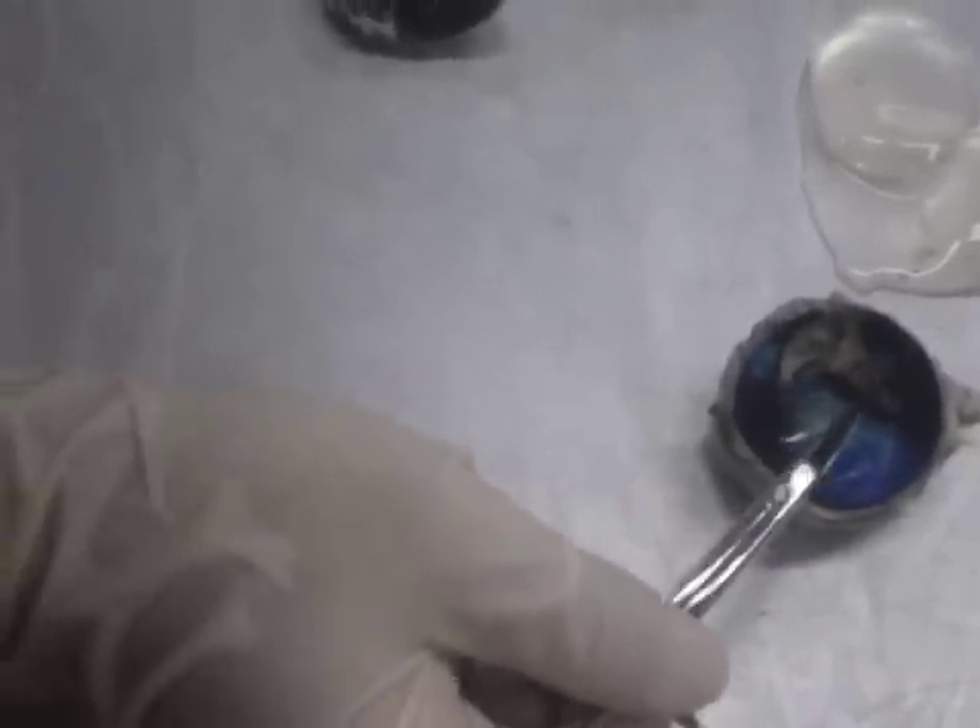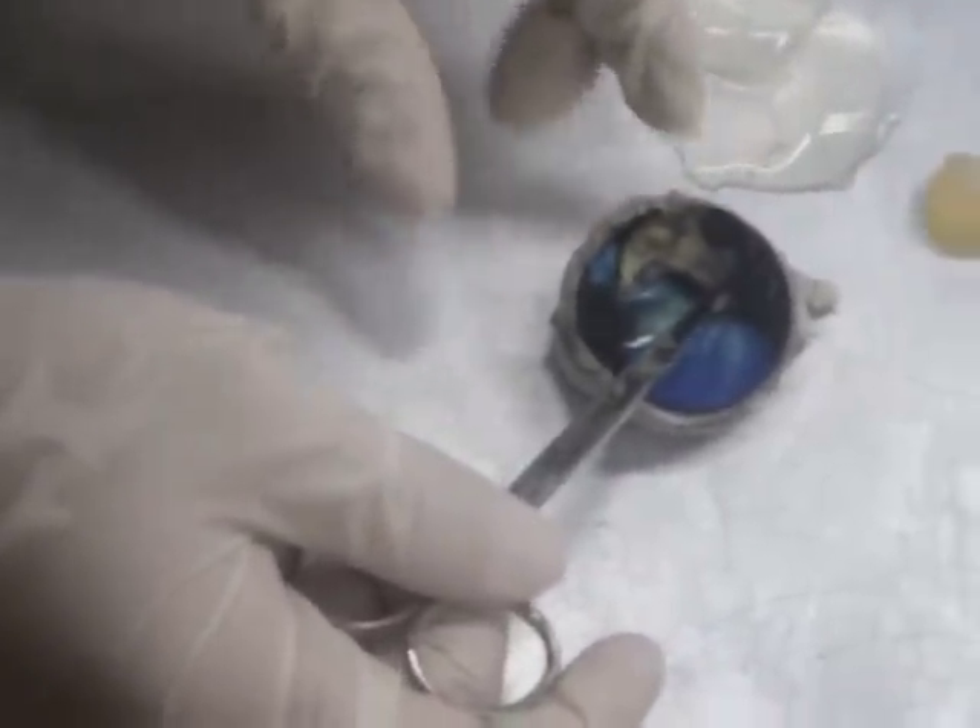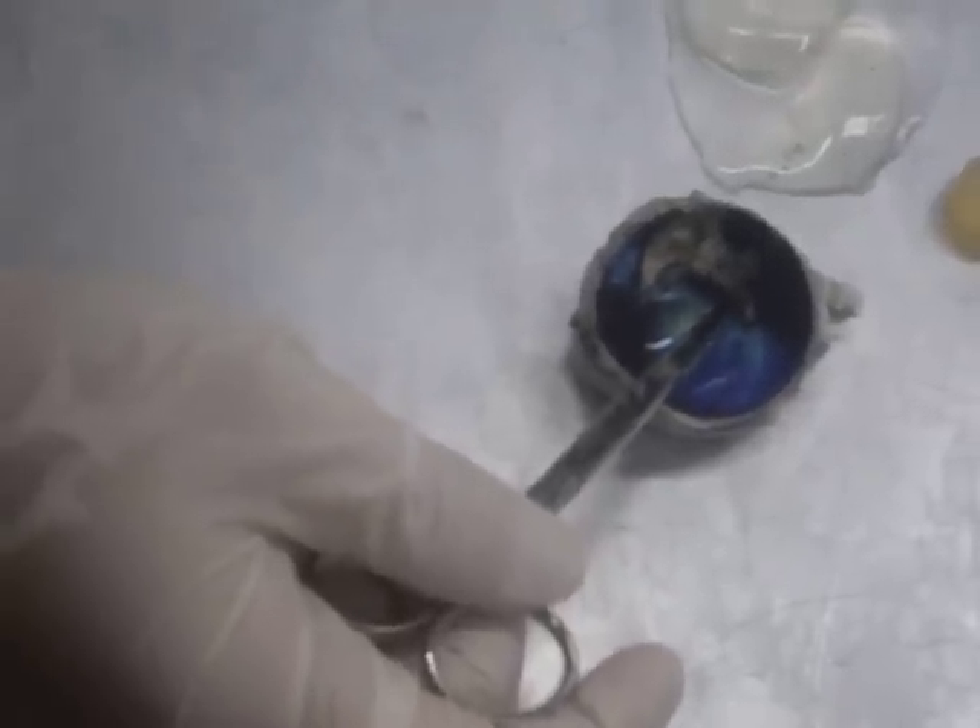After that, we will point out the optic disc, which is a hole in the back wall of the eyeball, which leads to the optic nerve coming out the back side of the eye.